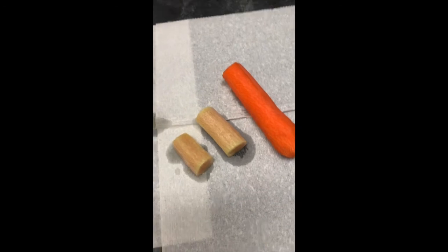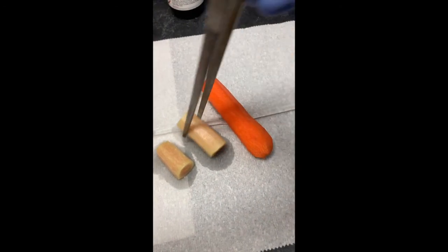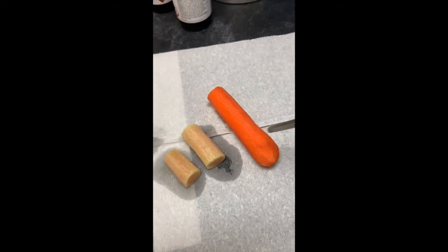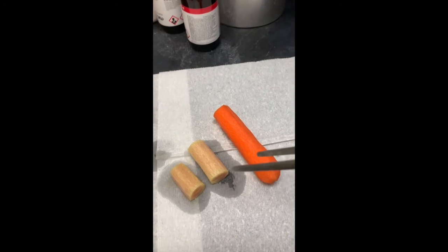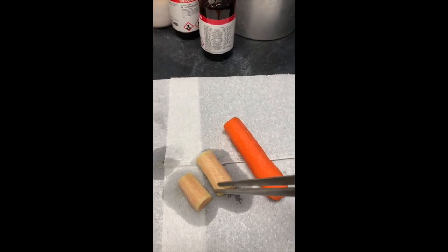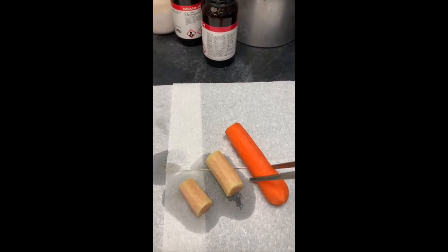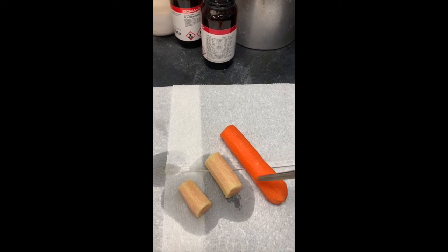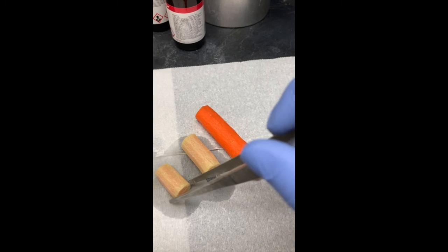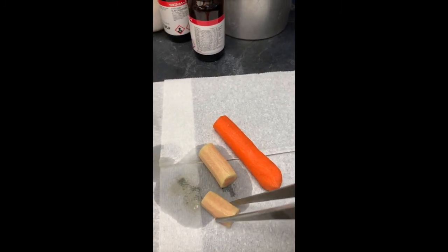As you can see, the carrot is now white. I think in the center it's probably still pretty orange. So once I have two hands again, I'll cut it apart and we'll look in the middle. But everywhere that the bromine was able to reach, the skin or the meat, I guess, of the carrot has turned a yellowy white color. It's gotten rid of its orange color. I'm going to take a moment and cut one of these apart and see what they look like on the inside.